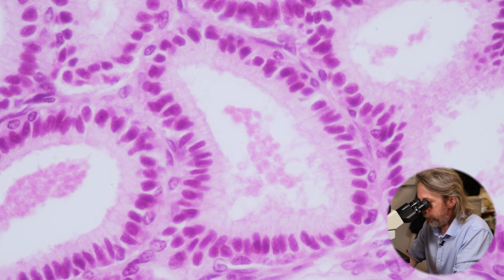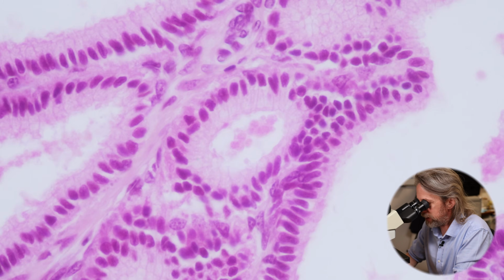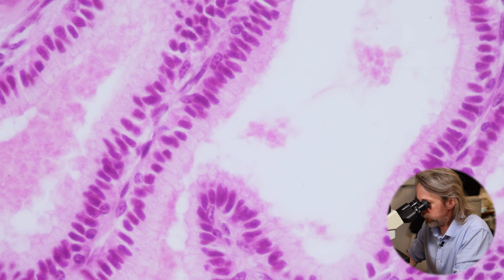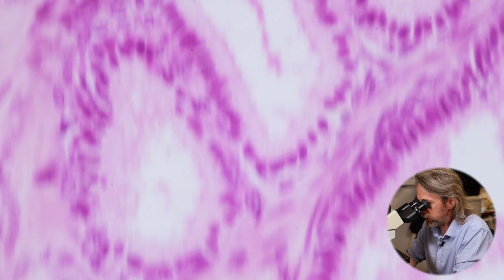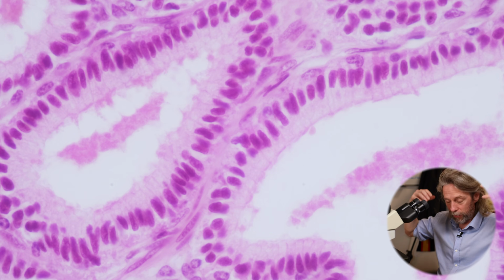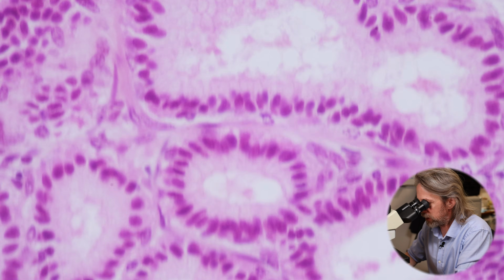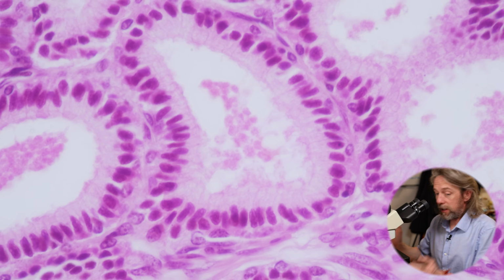And if we look through most of the gland, we just see repeating patterns of this wherever we look. That's pretty, isn't it? So these are branched glands, which is why we see the folds. There's lots of surface area. These cells are working very hard, making lots of secretions ready for ejaculation. And it's a really, really important process, because this stuff is really important. It's supporting the spermatozoa and maximising the probability of fertilisation. So there are strong evolutionary drivers for this. So that's it in terms of the epithelium.